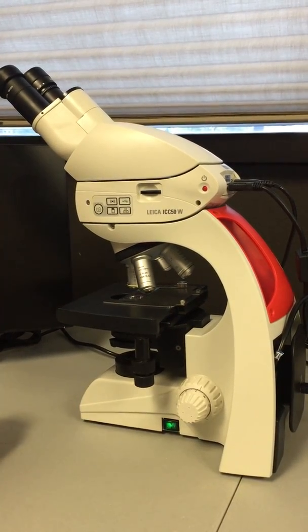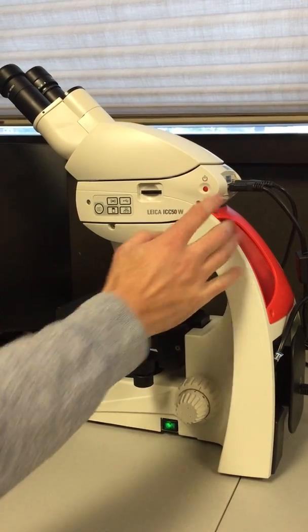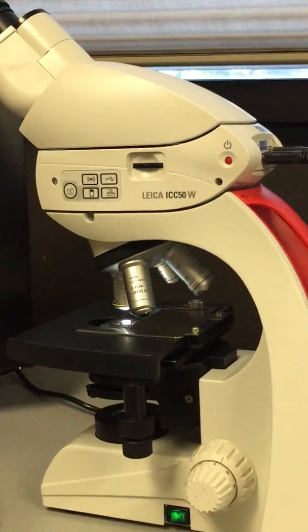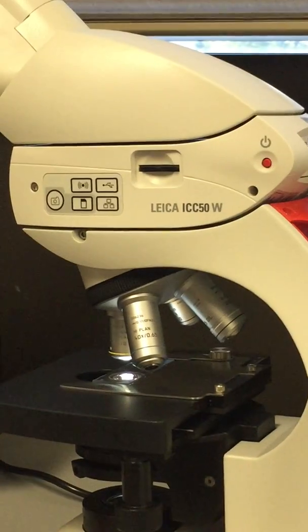First, turn on the microscope, and then you can turn on the camera. While the camera boots up, I'm going to show you the four output methods of this camera.